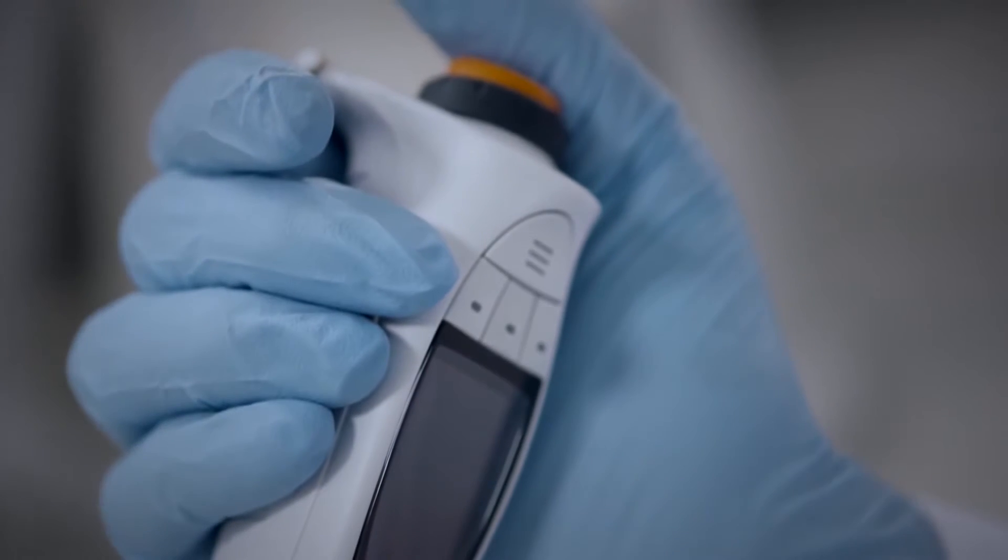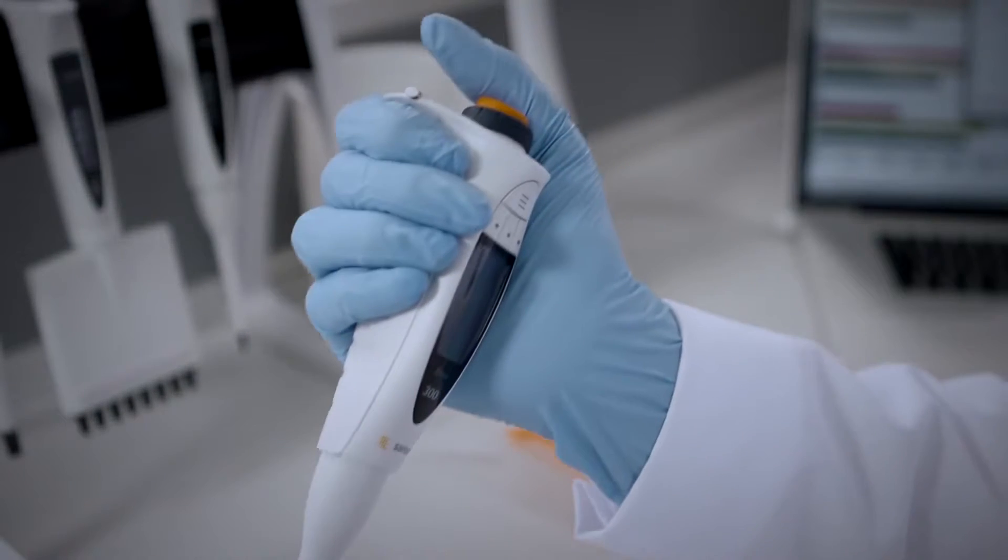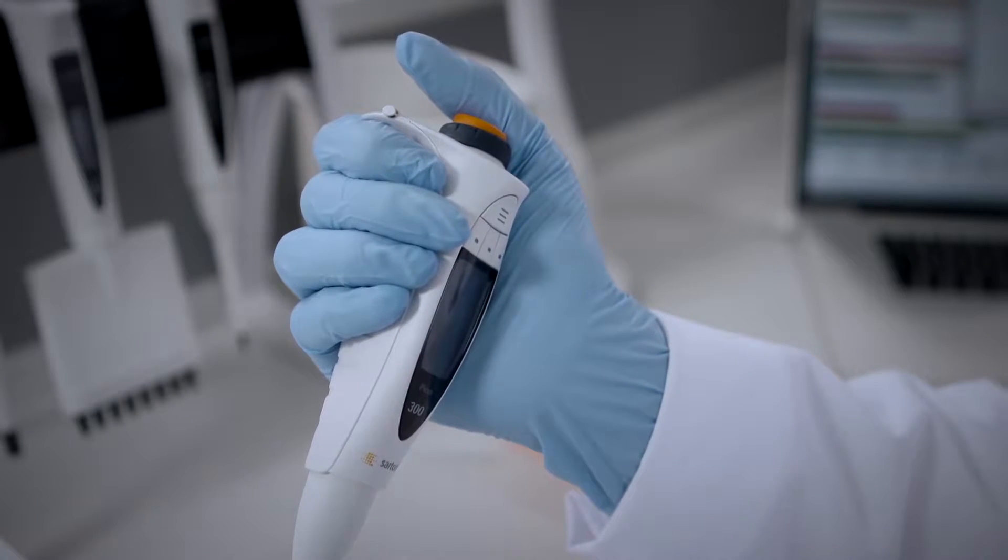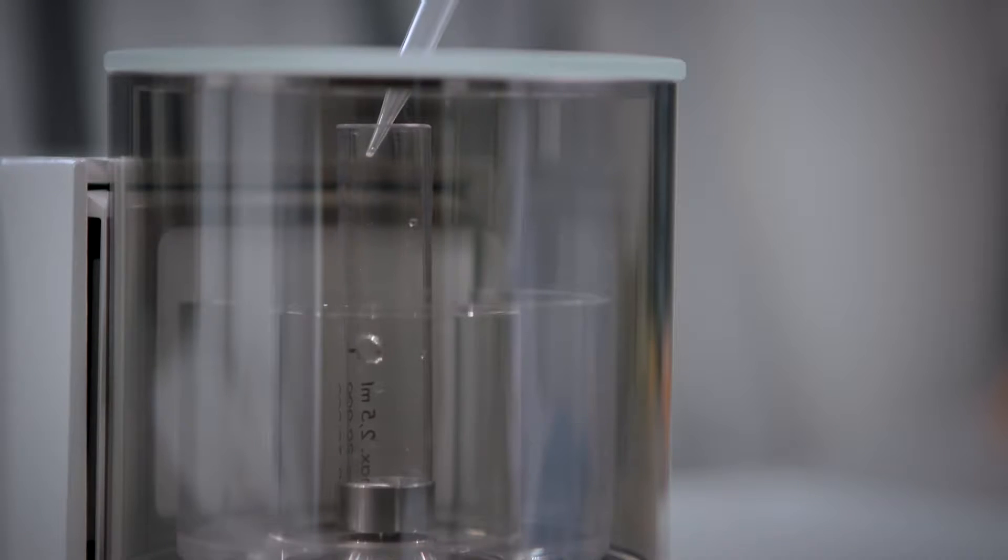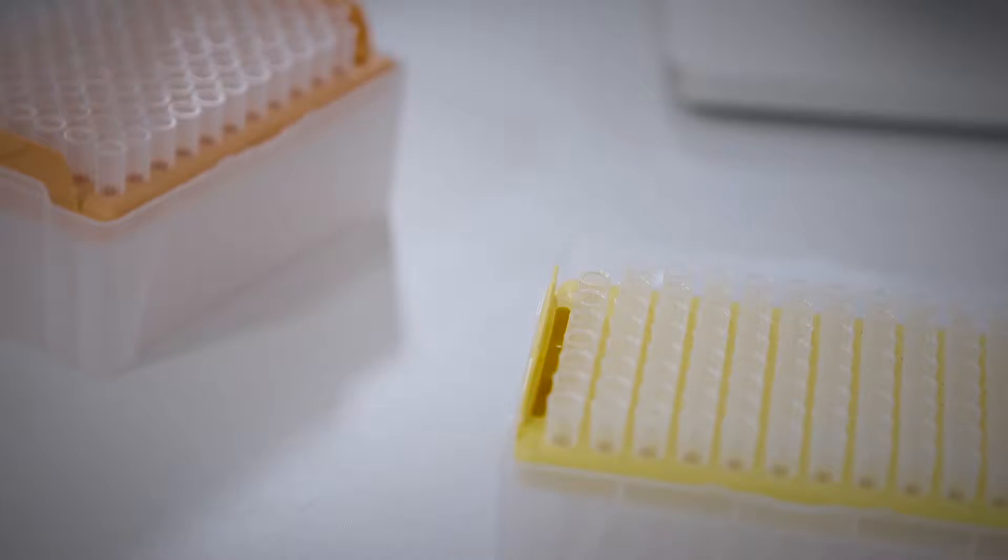Your pipettes need to be calibrated in order to ensure maximum reliability and be confident about the accuracy of your results. The most important factors for pipette calibration are the equipment, procedures and the environment. This video provides information on all of these factors.